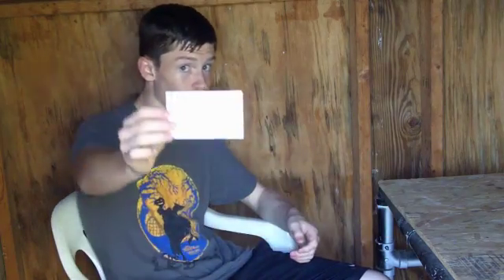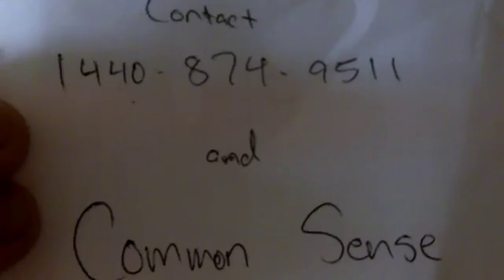She started by giving us contact info for if we needed any help. And then she got out a bunch of her safety equipment, like tongs, a pipette, safety goggles, plastic gloves, and I think a lab apron. And we went over to the nearest lab, and we tried to learn lab safety.